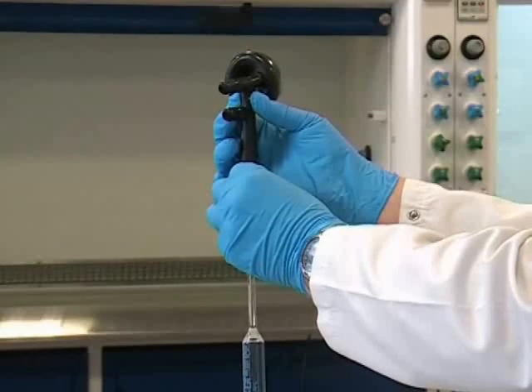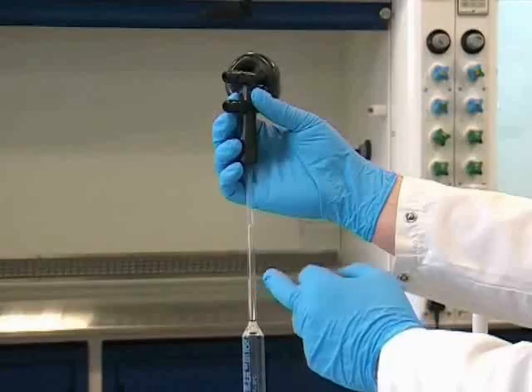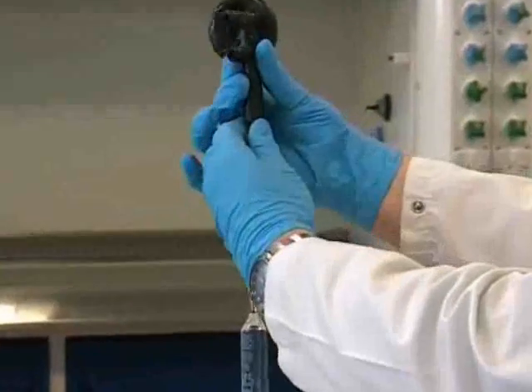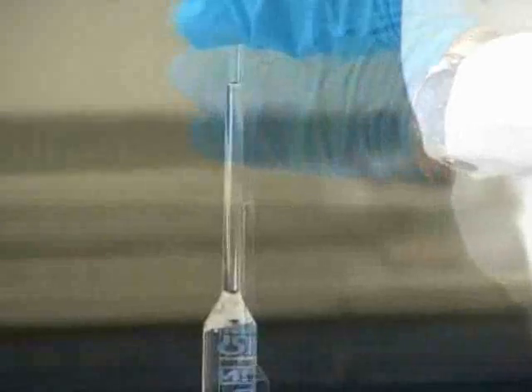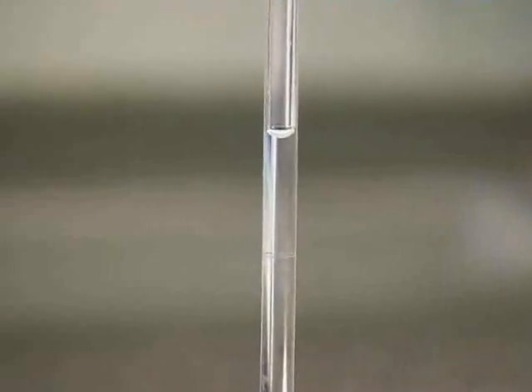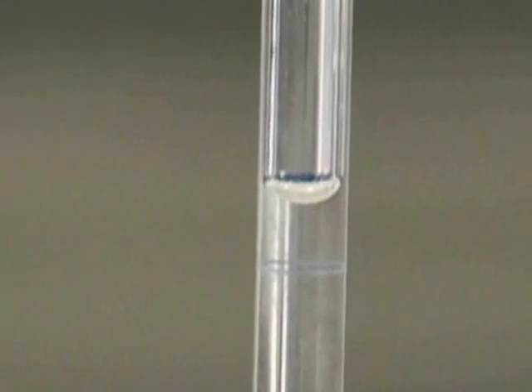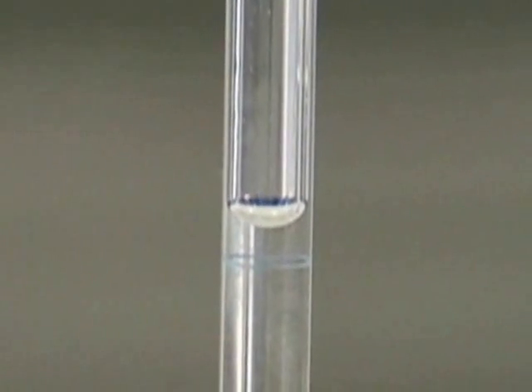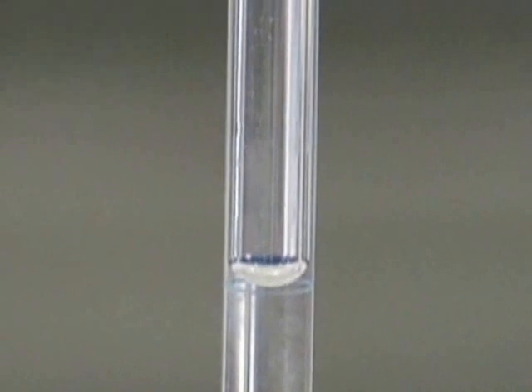Initially we're going to take more solution than we need. Here you can see the line on the pipette and you can see the solution is clearly above that. Now we can gently remove the rubber bulb and place our thumb over the end of the pipette. By gently moving our thumb we can release the solution in a carefully controlled manner until the bottom of the meniscus is touching the line on the pipette. Once the solution is on the line, we know that we have exactly 25cm³ of our solution.